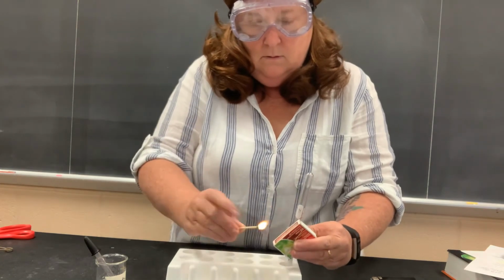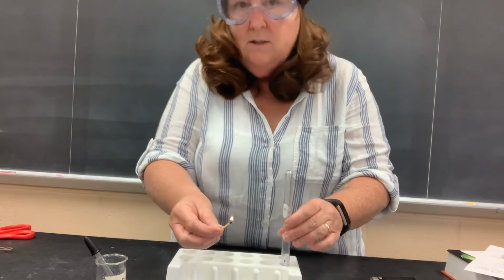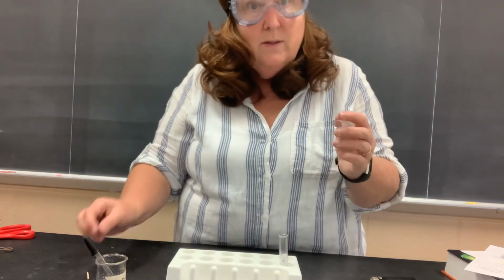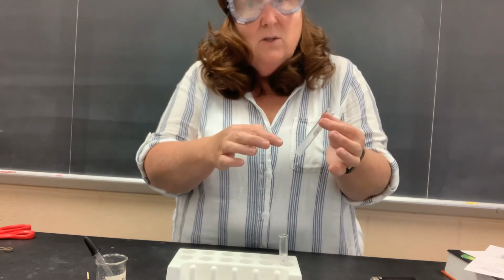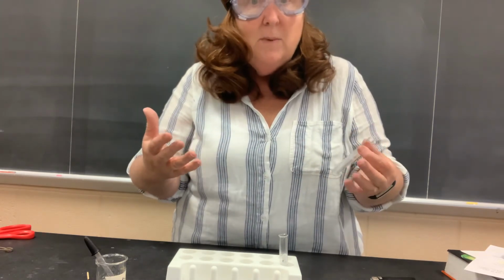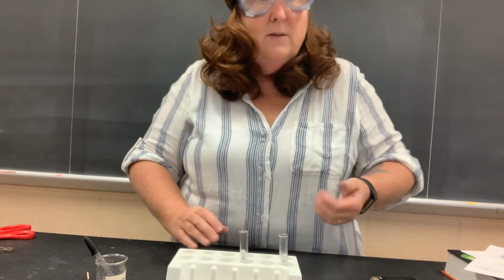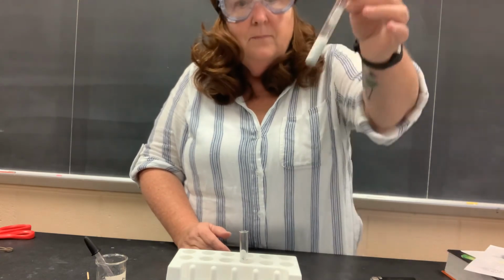Trap some more gas. See if this works. That popping noise meant that there was another chemical reaction that occurred. I had trapped the gas in the tube. That gas was flammable as well. Chemical property. A pop, you heard a noise, that's energy expended. That means a chemical change has occurred. So, chemical properties, it's not the same anymore. Just like the magnesium ribbon wasn't the same.